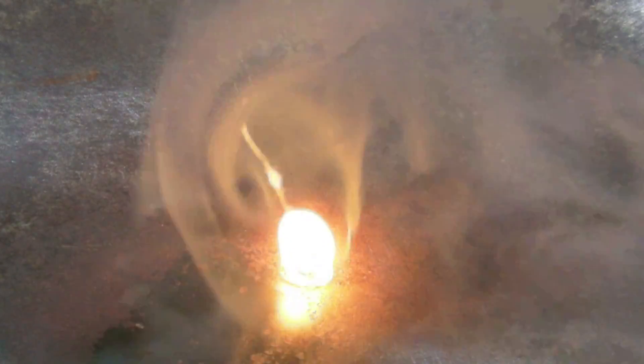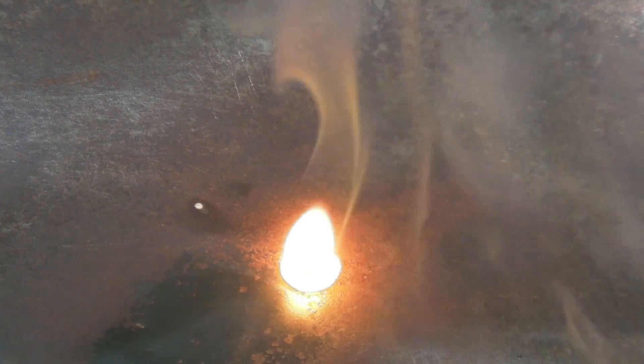Even touching it with a hot glass rod causes it to ignite. And sometimes little drops are sputtered which makes the fire unpredictable.